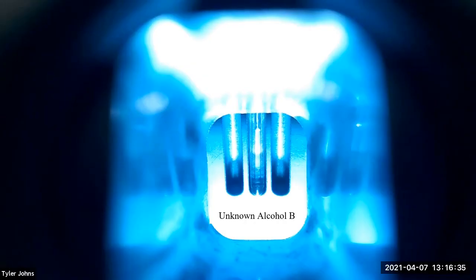We will now perform a micro-scale boiling point determination of unknown alcohol B.